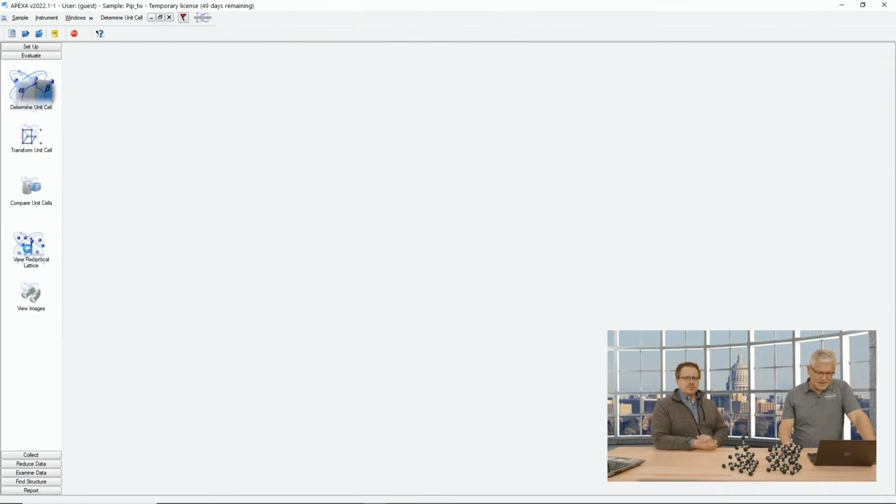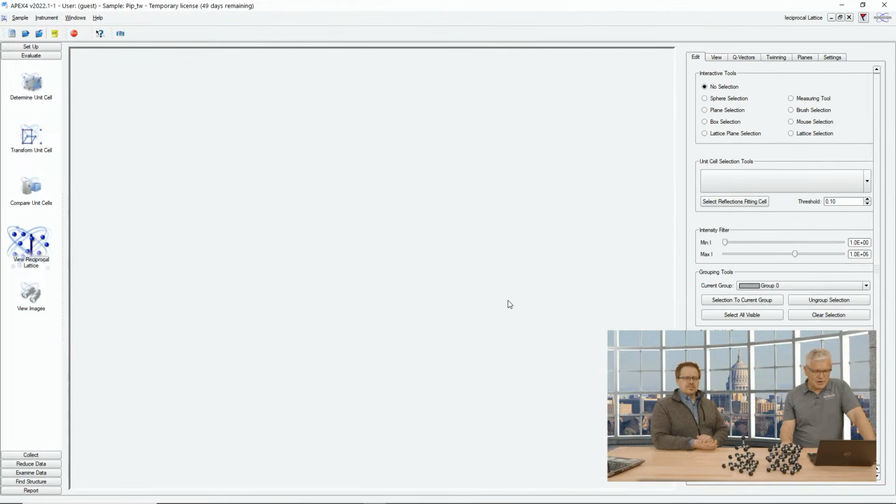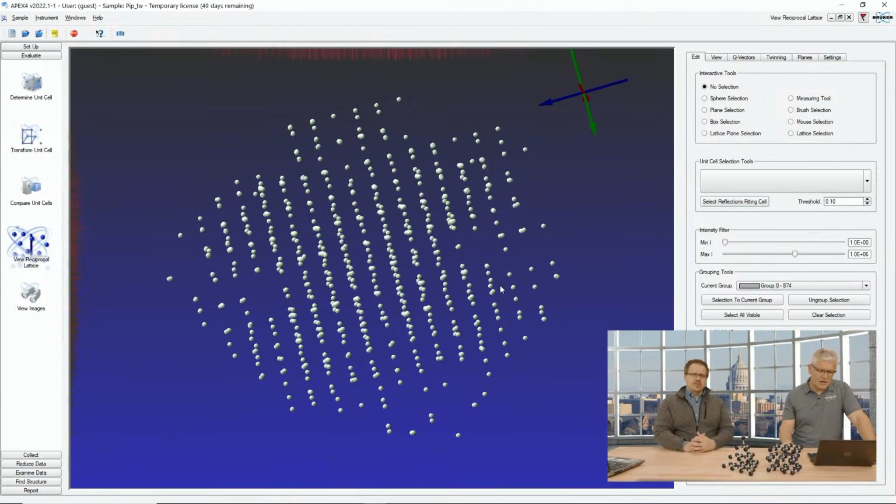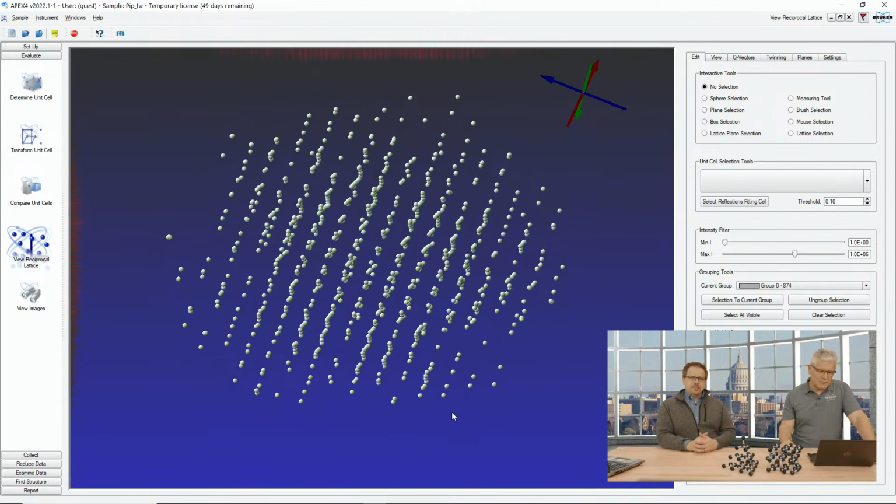And when we look at this in the reciprocal space viewer, right here, we already see that something is not quite right. In a single crystal, you would expect a pattern that shows rows of reflections and lattice planes, and right here, the zigzag is a really good sign for twinning. You get an idea that you have two lattices in reciprocal space that penetrate each other. Do you see the zigzag? Yes. So it's like a little lightning bolt. Almost, and typically you would only get nice lines.